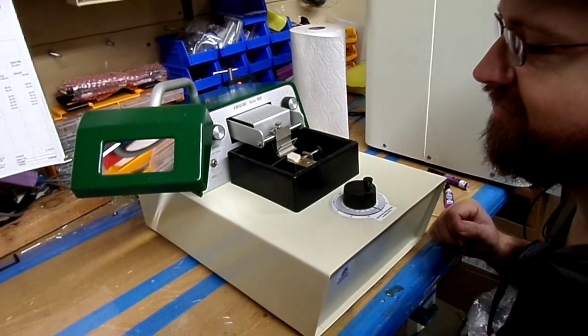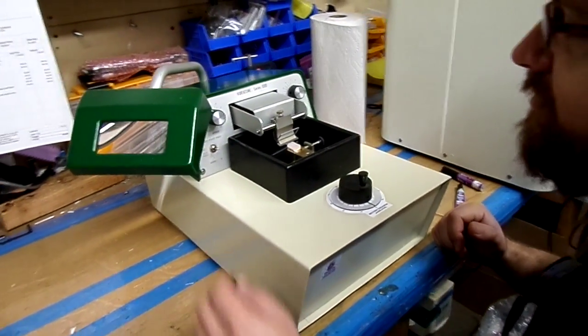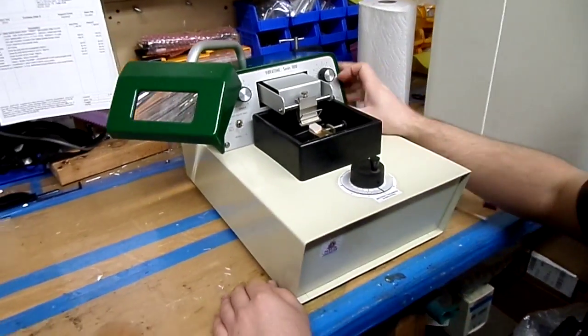Okay, today we're going to show you the function of your Vibratome Series 1000 Microtome.